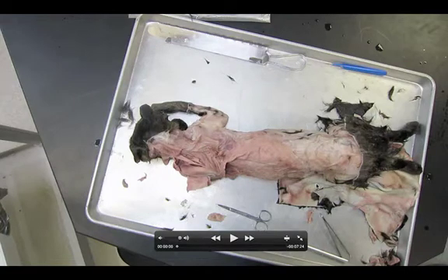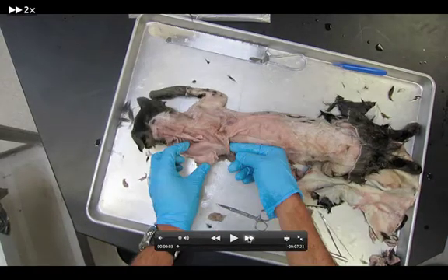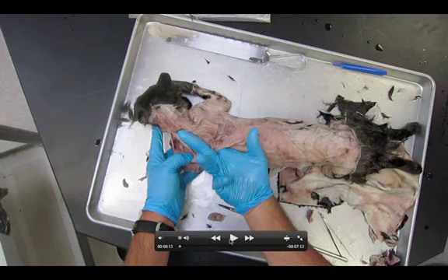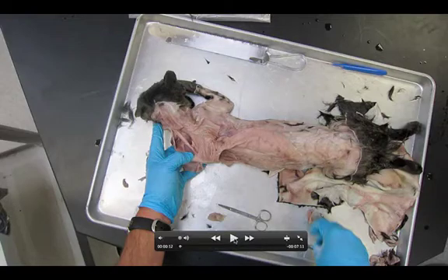Today we're going to take a look at dissection number three. First step — notice which direction I have my hand on this cat. We already have the rhomboideus muscle set up: rhomboideus major, minor, and capitis. We're eventually going to be cutting the rhomboids — not the capitis, don't cut the rhomboideus capitis — but the minor and the major.